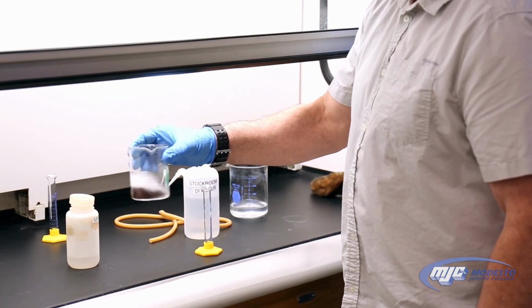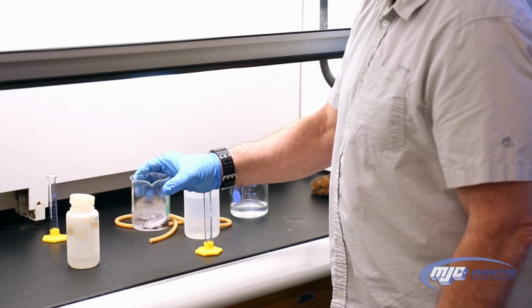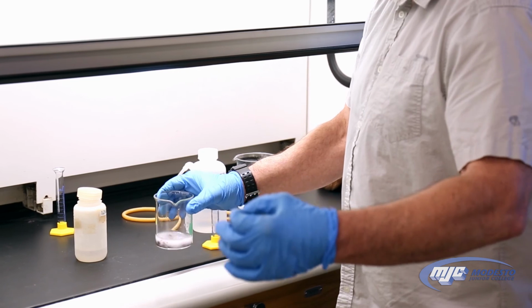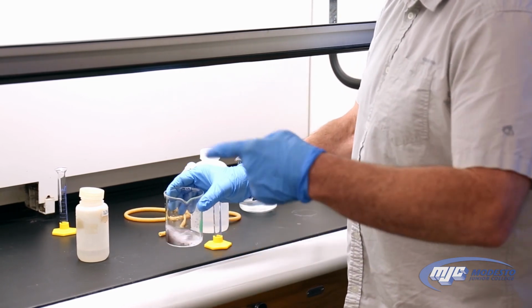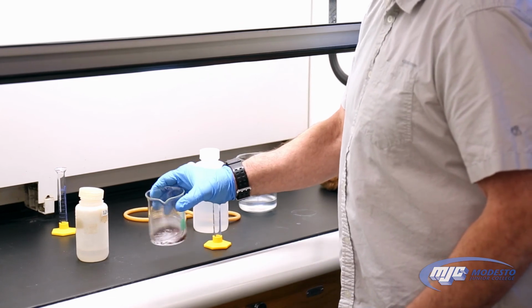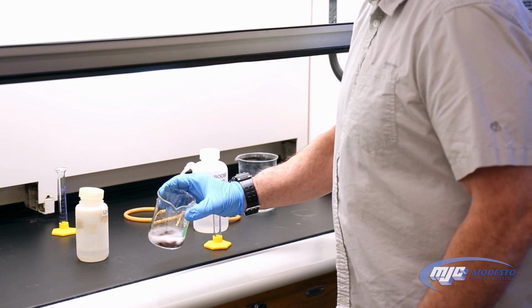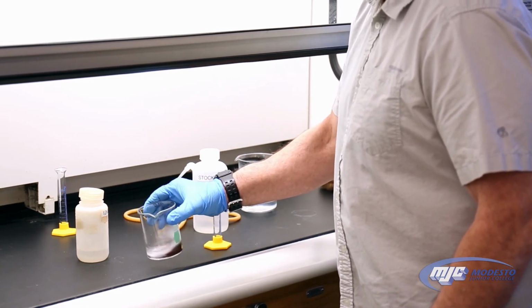That's the hydrogen gas that's being produced by the reaction of the zinc metal with the hydrochloric acid. So we'll know that our reaction is finished, that all the zinc has been removed. Not exactly removed. The ions are still in there, but they're ions in solution. They're not solid zinc metal anymore. We'll know it's finished when there's no more fizzing. Sometimes it takes a little while. Just give it a stir every now and then and let it react.